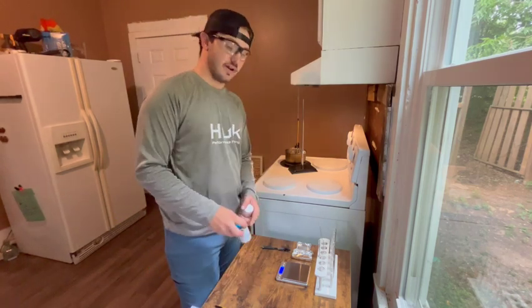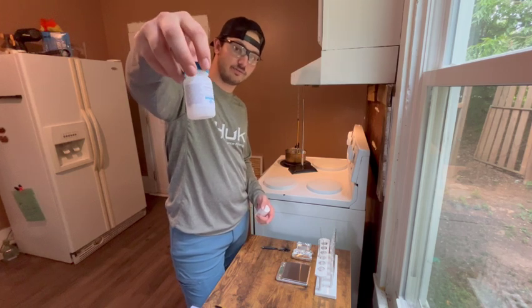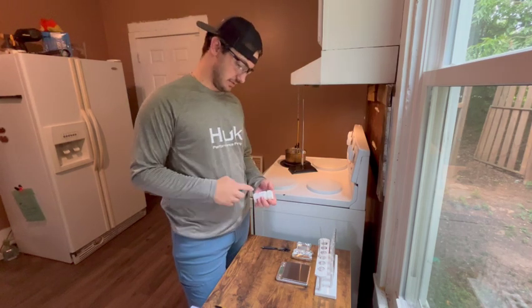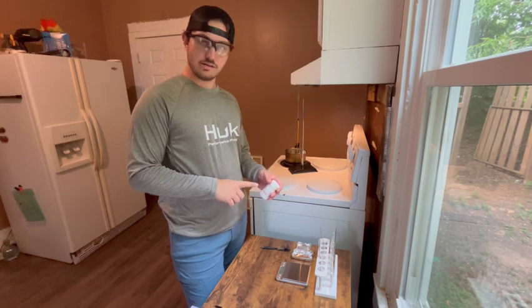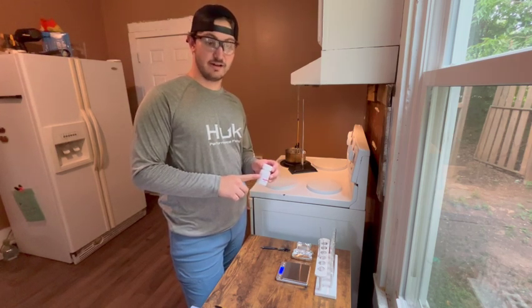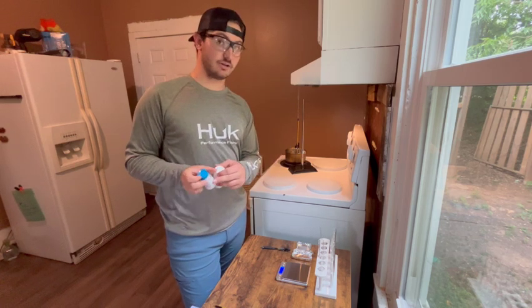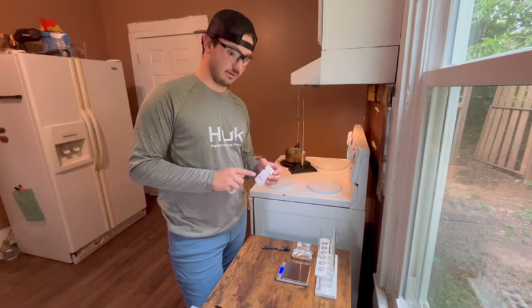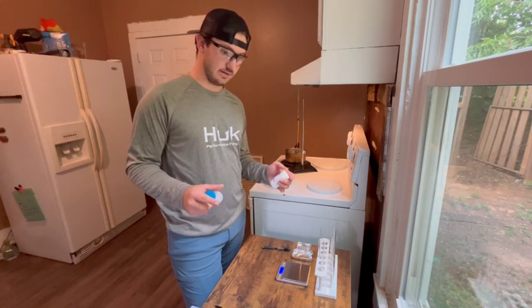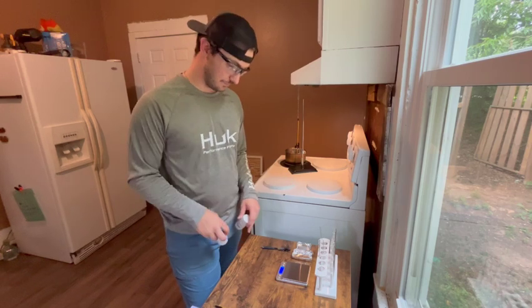And by knowing the freezing point and melting point of paradichlorobenzene, and then calculating the freezing and melting point of the solution of both paradichlorobenzene and naphthalene, we can calculate the freezing point depression of the solution.